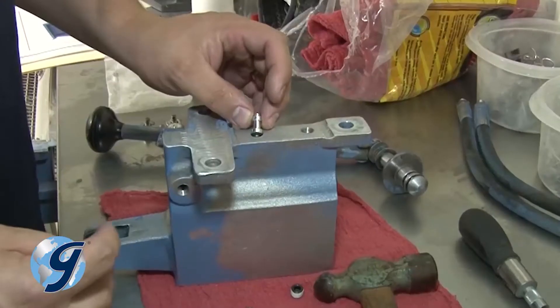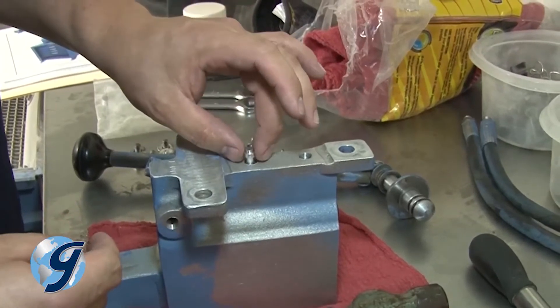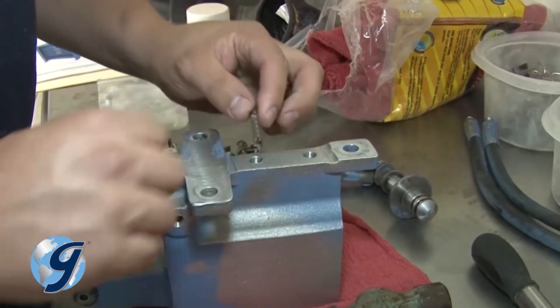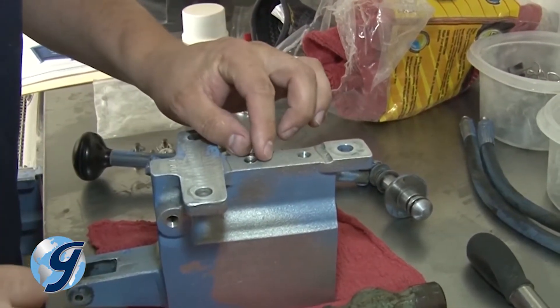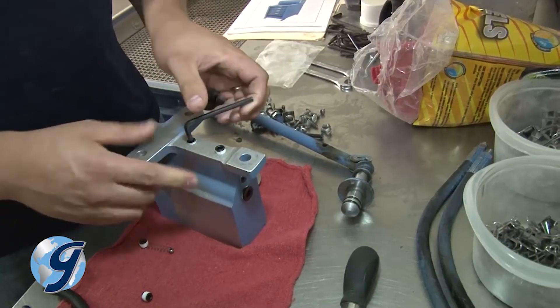Next, fit the pressure check O-ring to the pressure check thrust pin and install it on the underside of the pump. Follow with a slightly thicker and shorter pressure check spring, and then finish with the new plug.